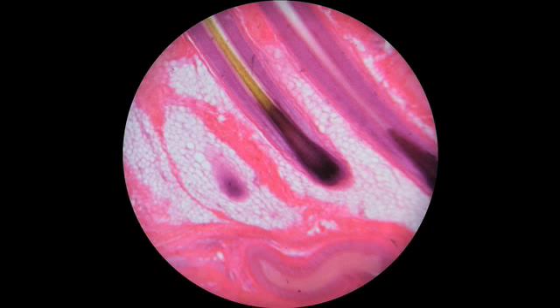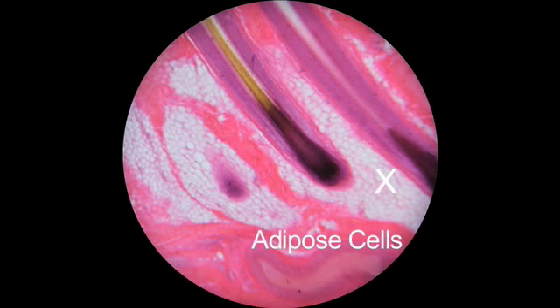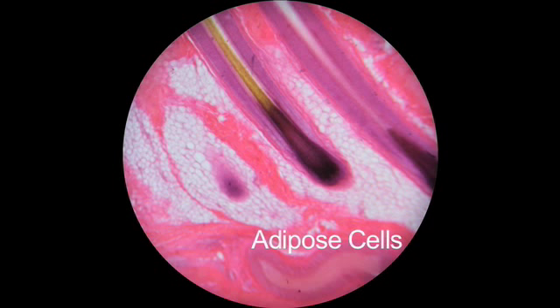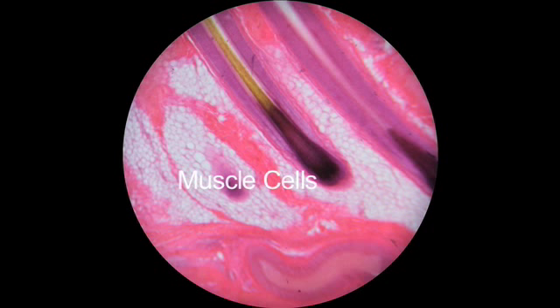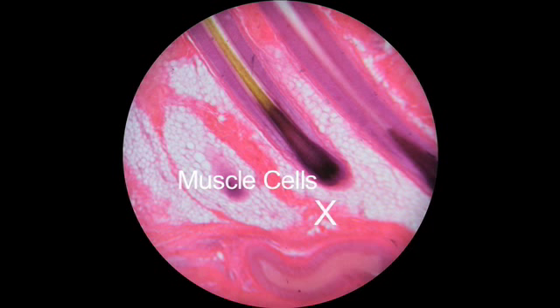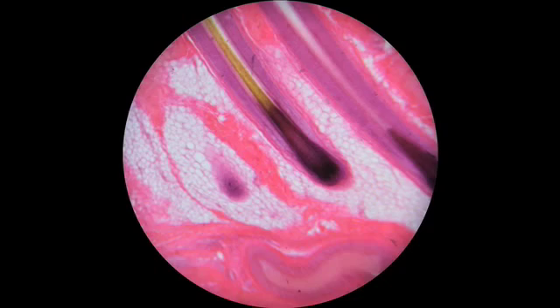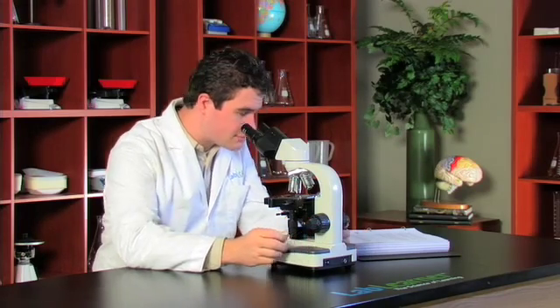Also in this layer, we have a lot of adipose tissue in the form of adipose cells. These are essentially fat cells, which give us thermal insulation of our skin and help keep us warm. Finally, we see that there are also muscle cells — that's the pink tissue stained here — and it's the contraction of these cells that causes the hair on our arms or legs to stand on end when we're frightened or cold.